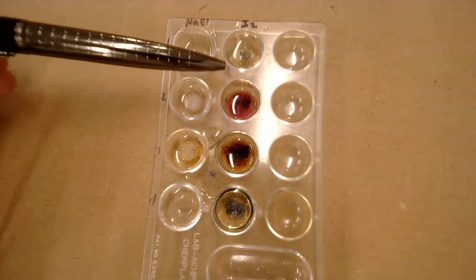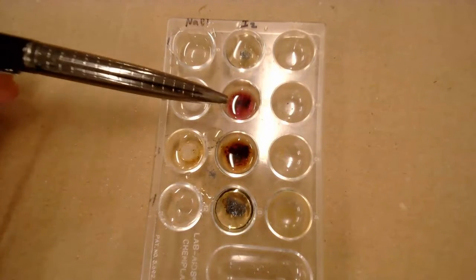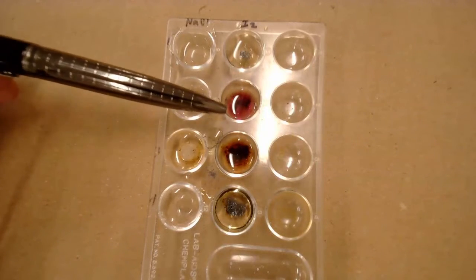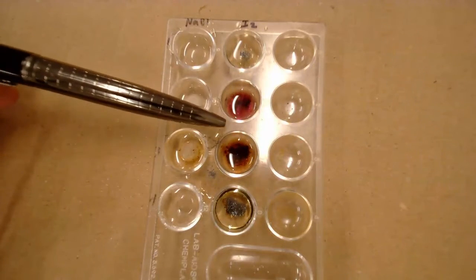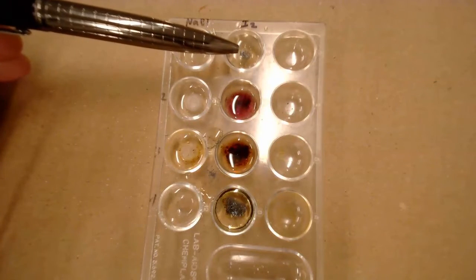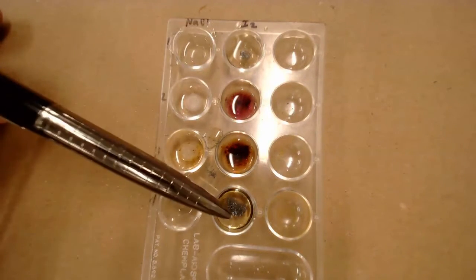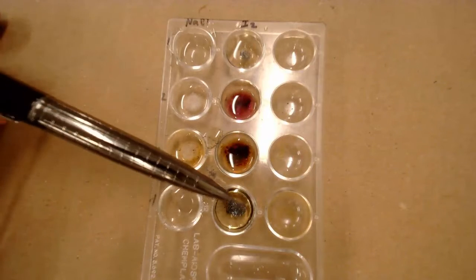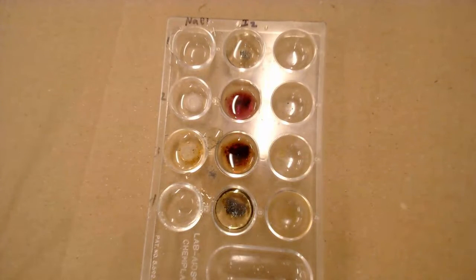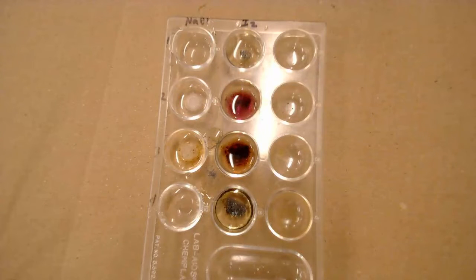On the iodine side, you can see how these two in the middle have the color spreading out — those two are soluble, the iodine is soluble with those two liquids. But the iodine is not soluble with the water or the glycerin, because you can still see all the little tiny particles. So that's the first part of the lab — you should be able to write down whether something is soluble or insoluble in those four different liquids.